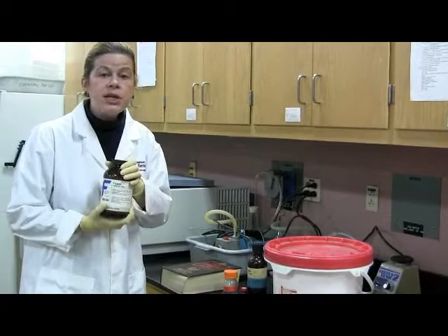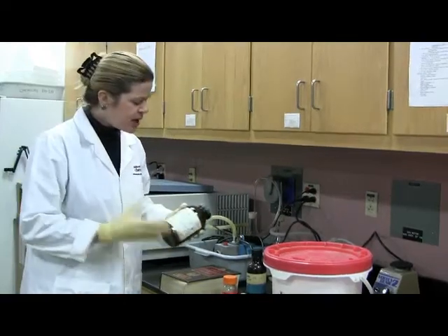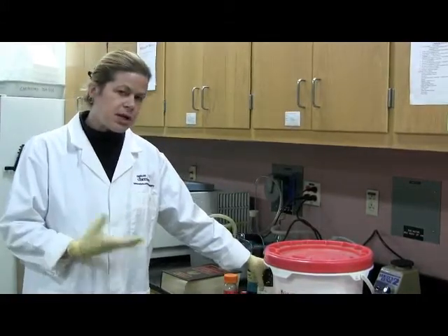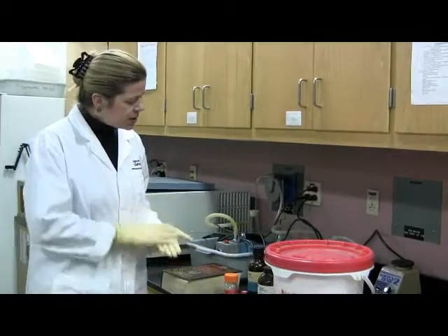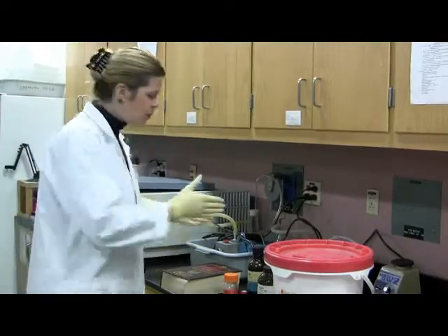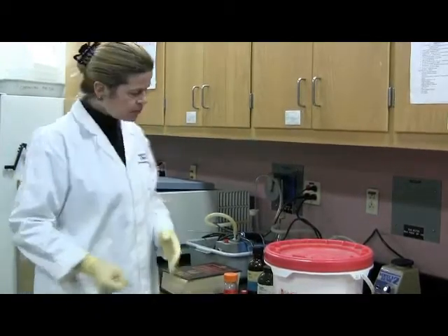It chops proteins. So that means it chops itself up, which is a problem when you're doing enzyme kinetics, because that means that the activity is going to go down, and that is not a result of the trypsin being inactive, it's a result that it chops itself up. So what you need to do is keep it very cold and then act fast. So when you have all of your other solutions ready and you're ready to start measuring the kinetics, then you prepare your enzyme solution. Okay?